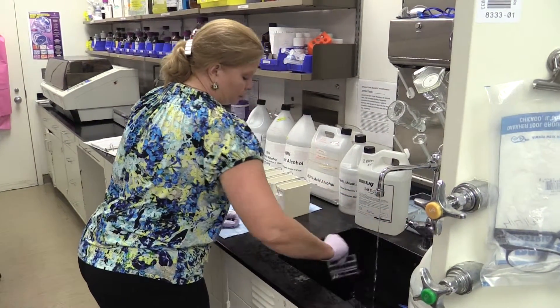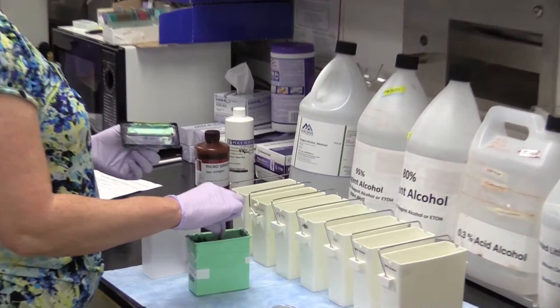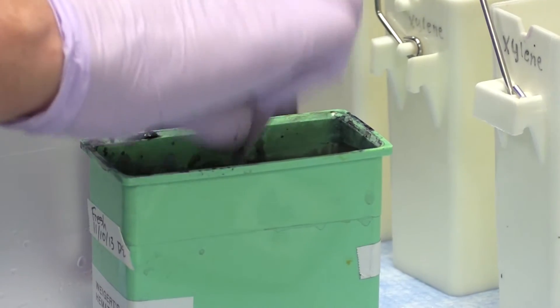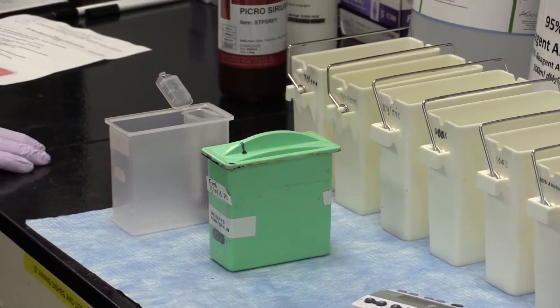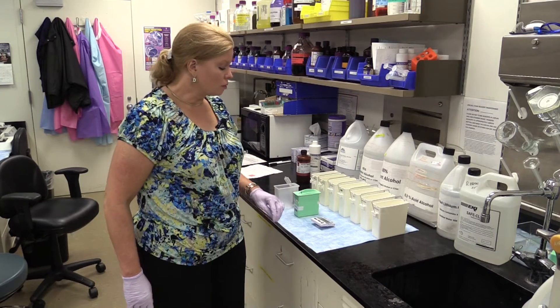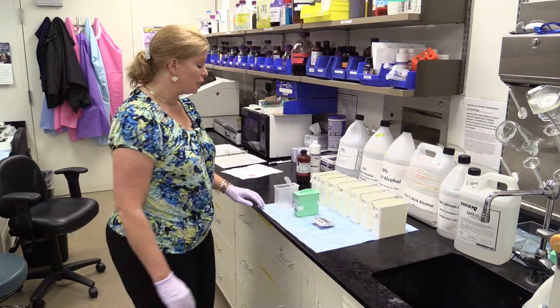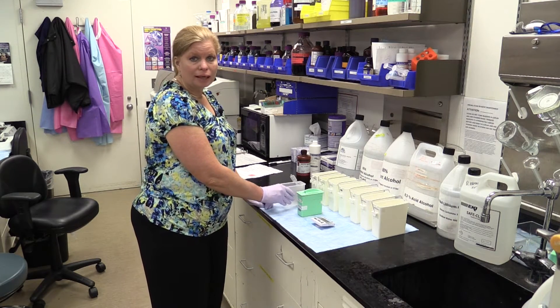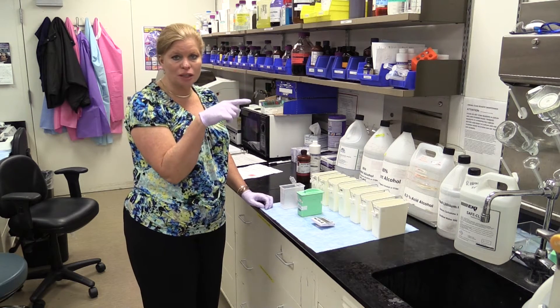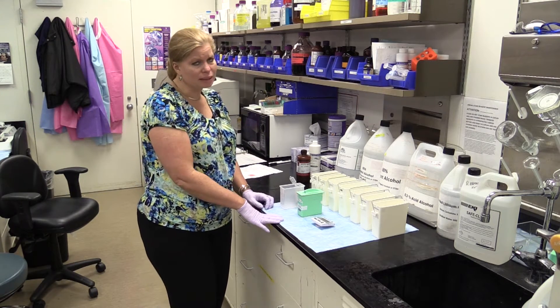We've been a minute in the water. I'm going to shake off the excess water and put this into our Weigert's hematoxylin. I agitate it fully to make sure it's good and stirred up with my fresh hematoxylin. The Kiernan book recommends 20 minutes in the Weigert's hematoxylin — I recommend at least 20 minutes to half an hour. The reason is the Picrosirius Red itself actually differentiates this hematoxylin and takes quite a bit of it out. When you see it under the microscope you just see the delineation of the nuclei, but you don't see it really black like you might in the trichrome, because that's not its main purpose.